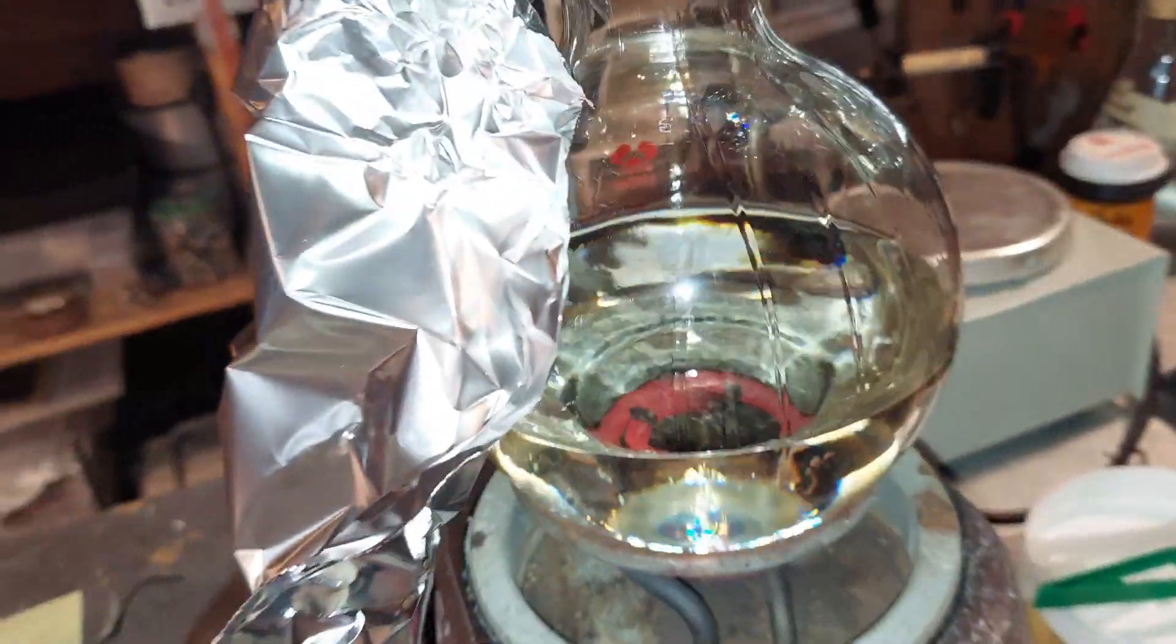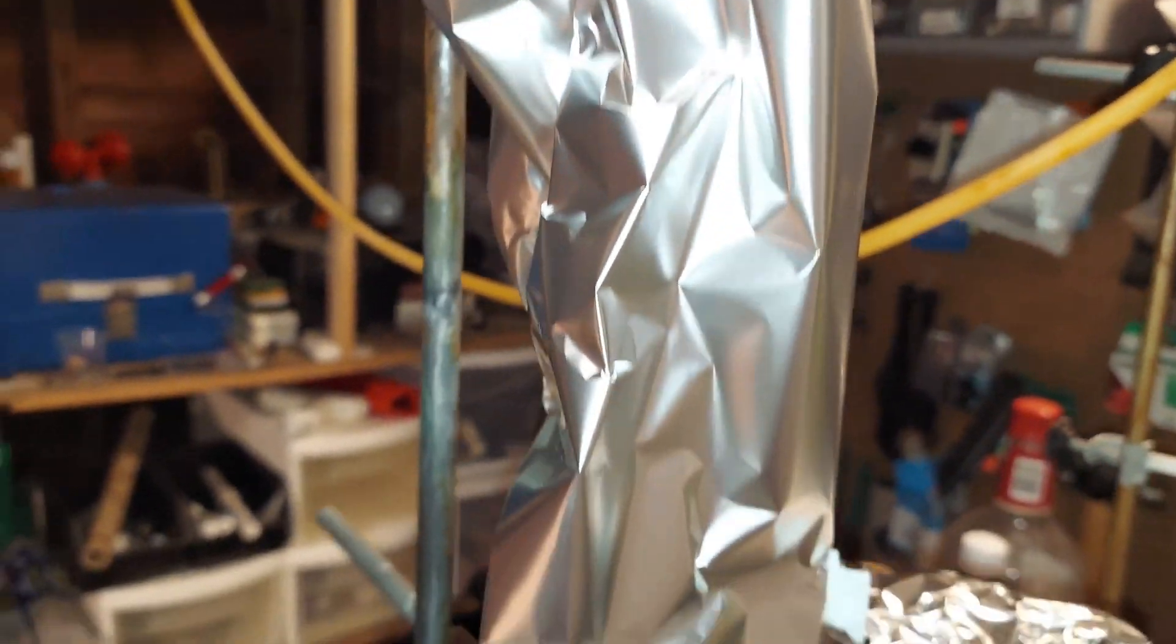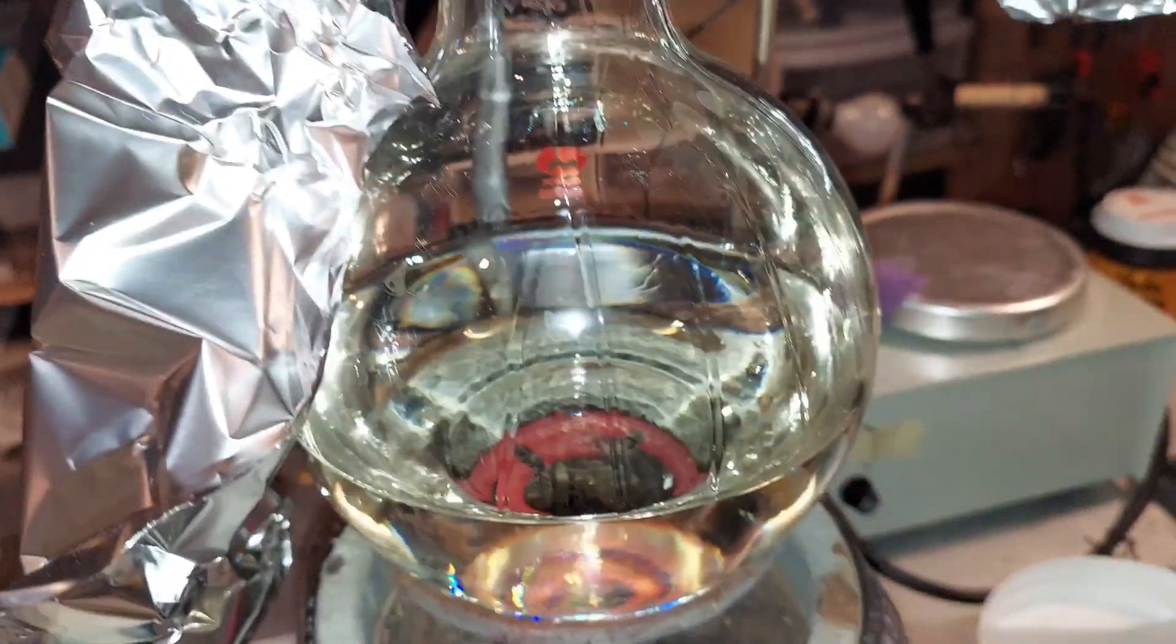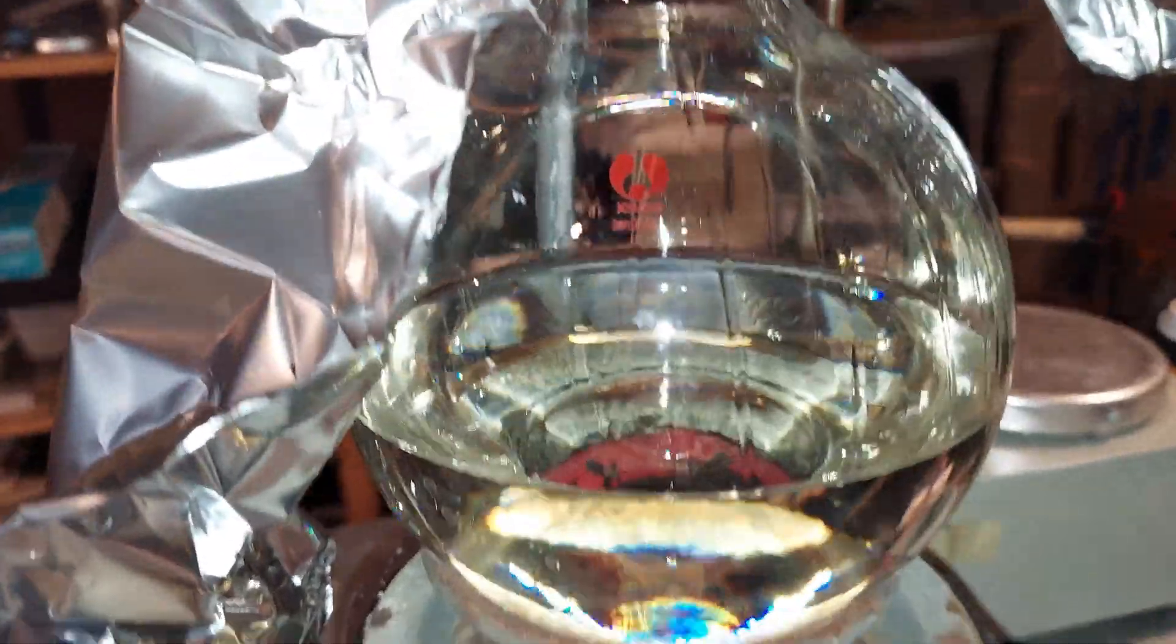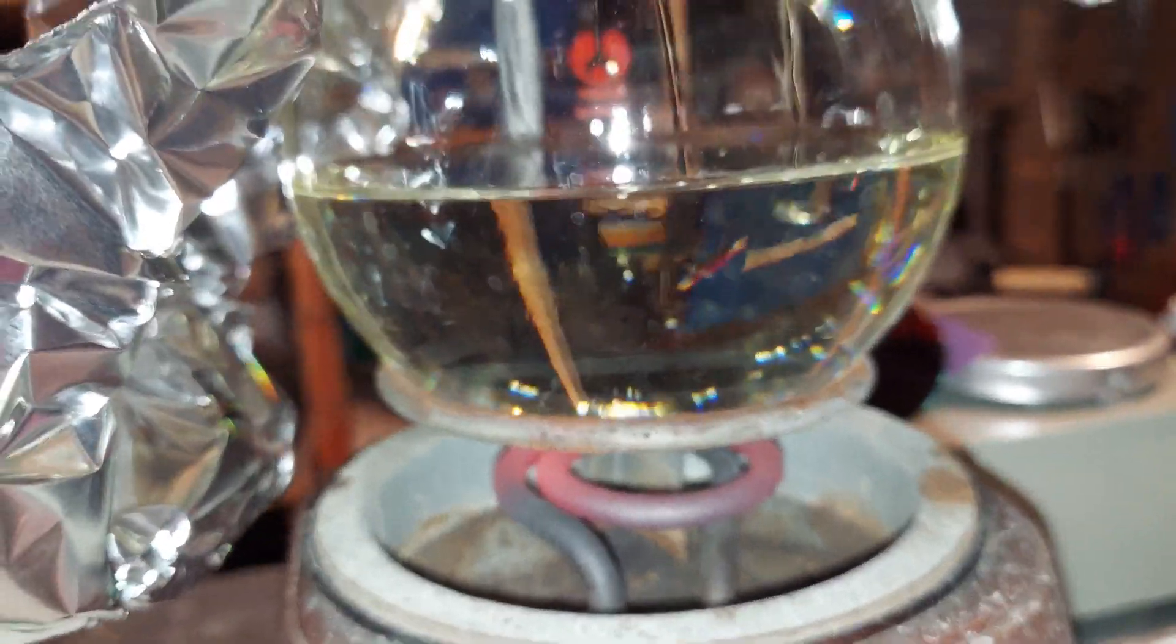This has been running a little bit now, and I covered the fractional distillation column to maintain the heat as much as possible. It was cooling down, I think. And it's cleared up quite a bit, which is normally what happens.